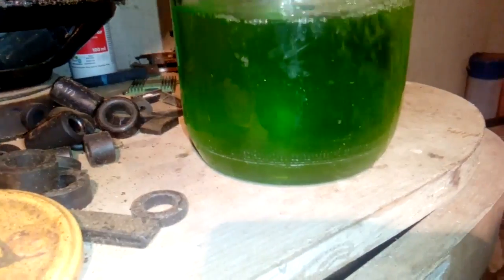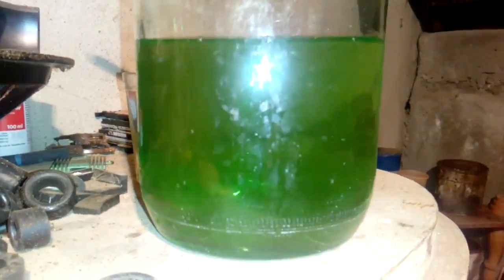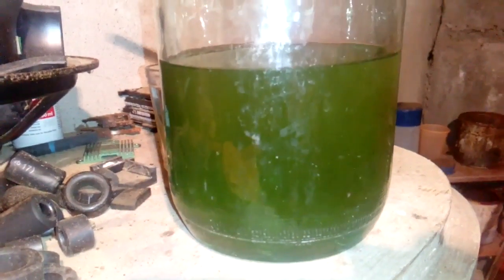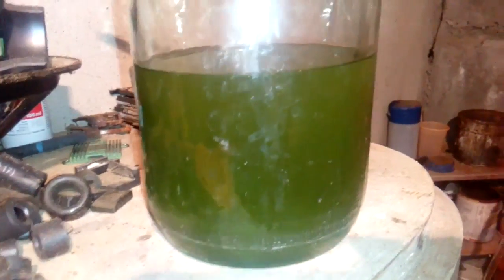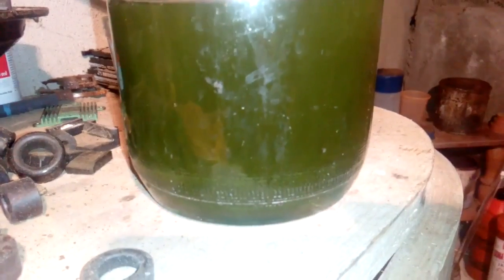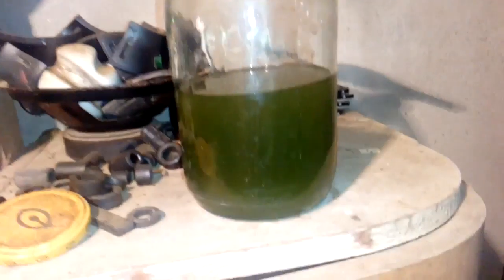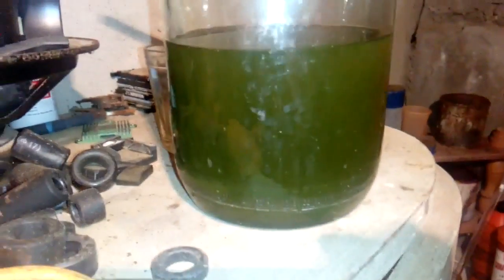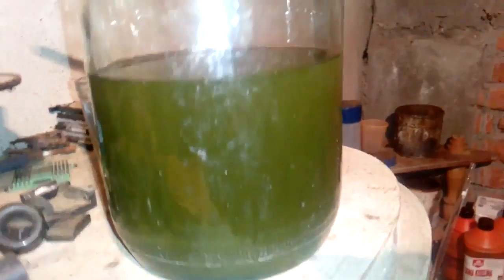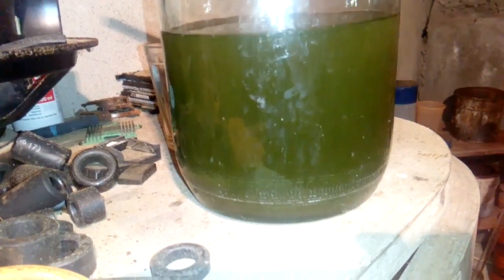Now we drop some gold. Not much gold inside, I don't expect too much, but never mind, just fiber CPU. This angle is much better to see. So leave that to morning, the gold settles down, and we will see how much gold we got from 140 gram CPU pins, fiber CPU pins.